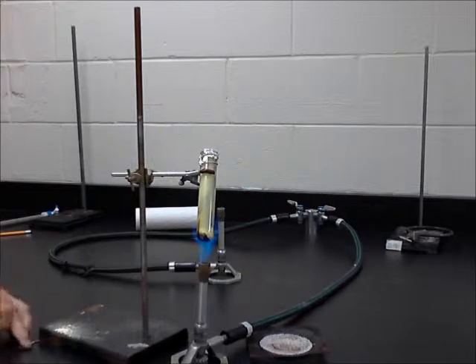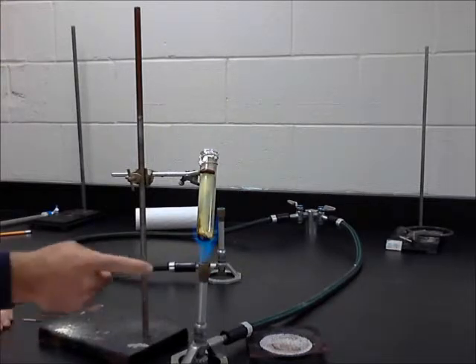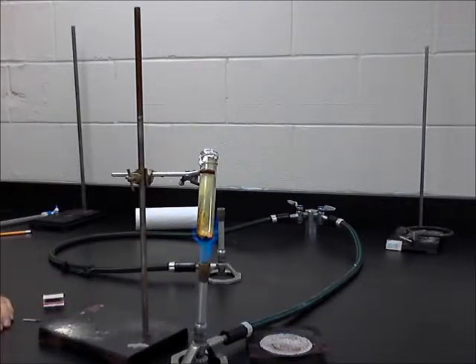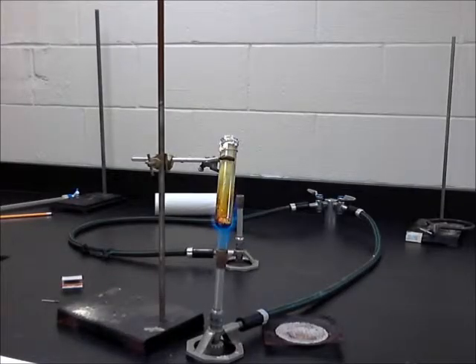Shouldn't take real long. It gets pretty hot. Make sure you're at the cone. That's how well you can see this. Let's try this once. I'm not going to be able to get that camera that close. Alright, so it doesn't take long.